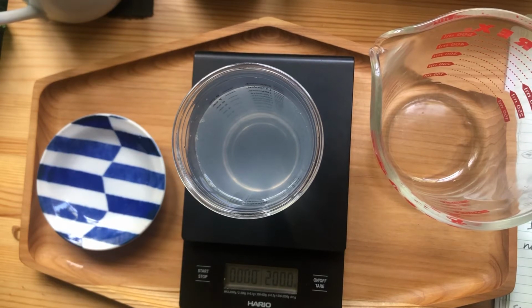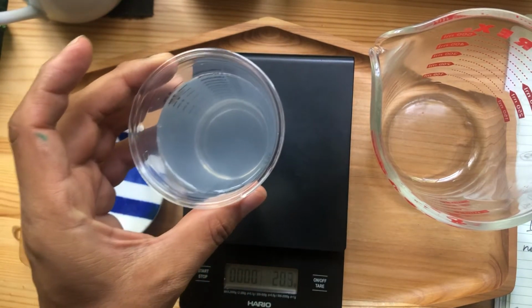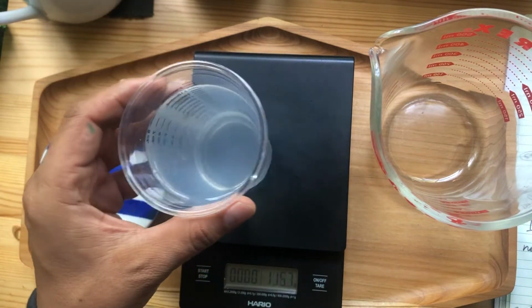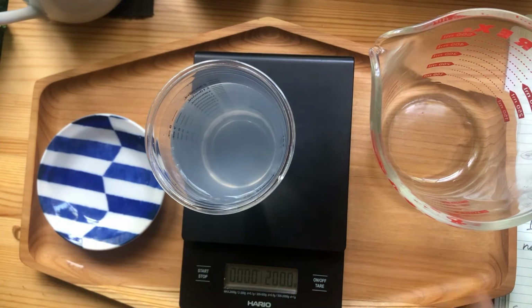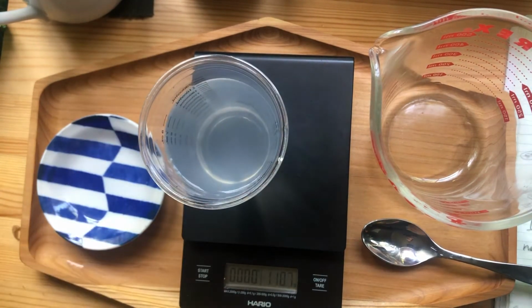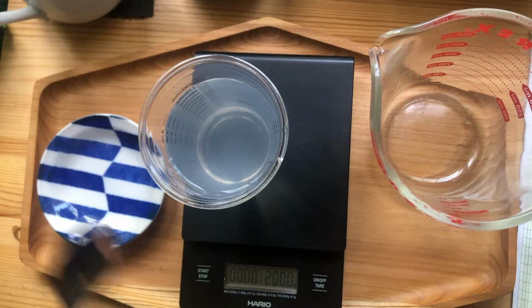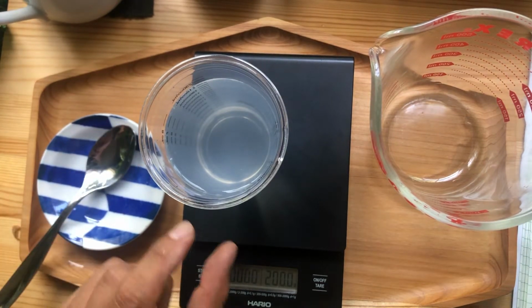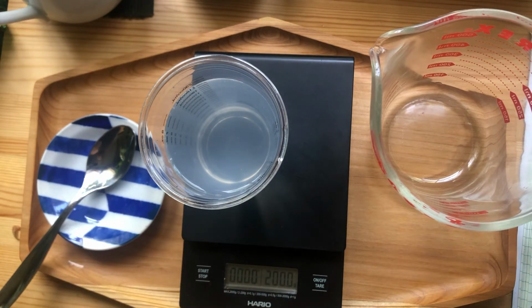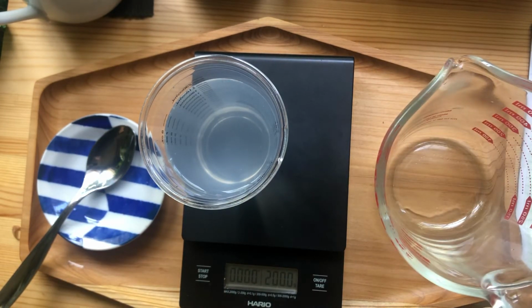Alrighty, folks. So we have our stock solution, and we want to make a solution that is a little less concentrated. This sort of thing happens, like if you have a Gatorade concentrate and you want to make a liter of Gatorade, you have to figure out how much of the concentrate to add to how much water to get the solution just right. So let's make a new solution.